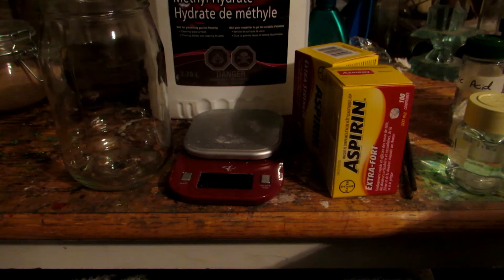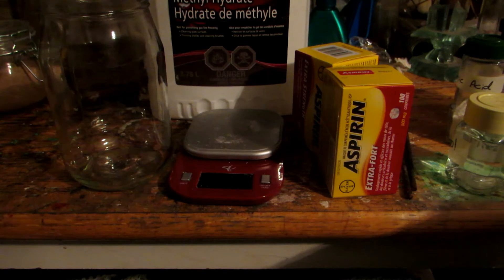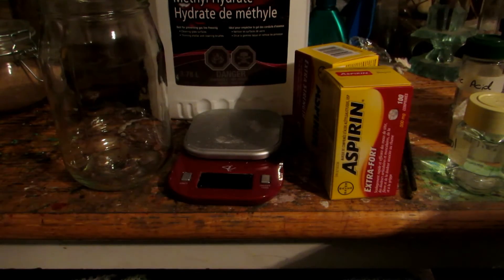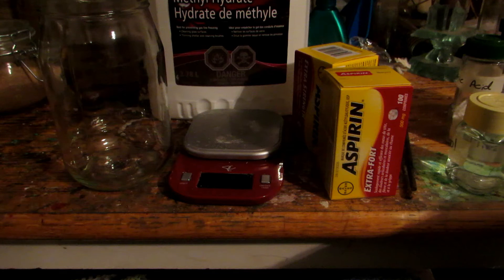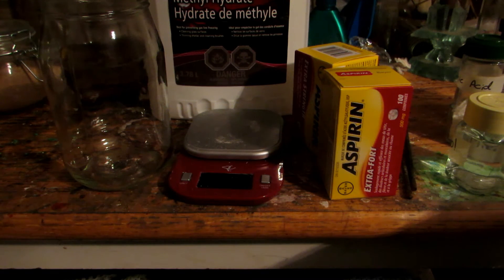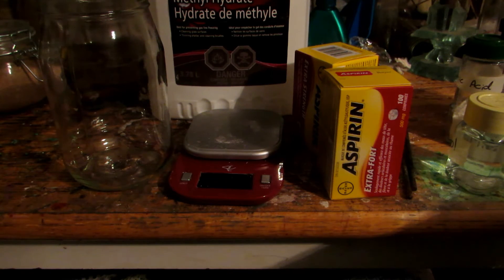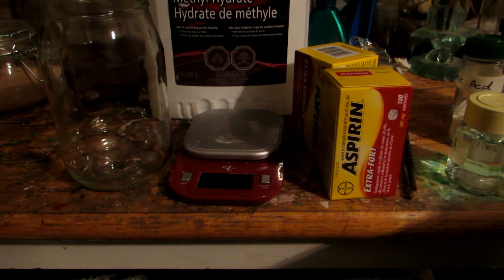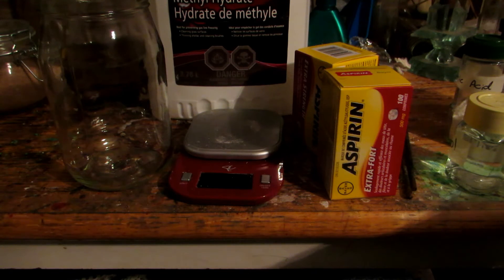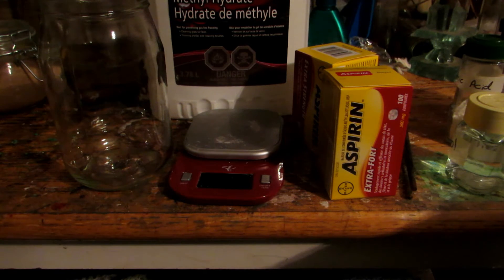We're going to use about 700 or 800 milliliters of methanol to make sure all the acetylsalicylic acid is dissolved. Let's start by crushing up both boxes of aspirin tablets. It's a good idea to make sure they are white and not pink or red, because dye can be difficult to get rid of — white tablets have no dye and will give a purer product. We'll crush them in a coffee grinder strictly dedicated to science, though a mortar and pestle or hammer would also work. Crushing is important because otherwise it's really difficult to dissolve all the acetylsalicylic acid.